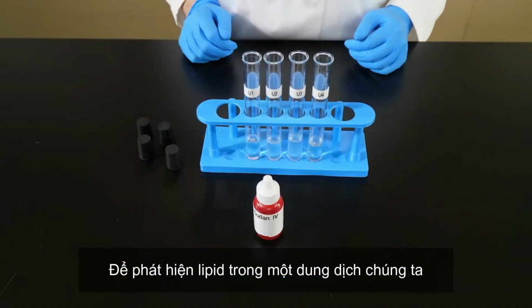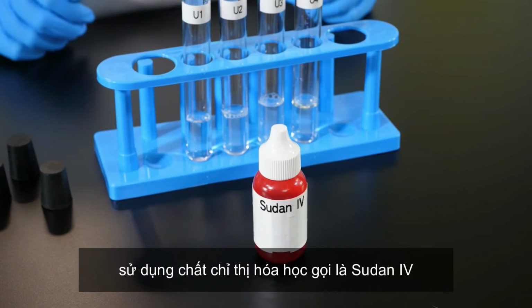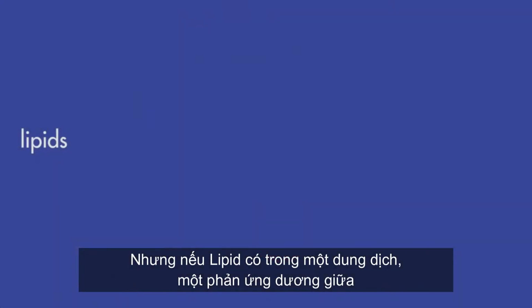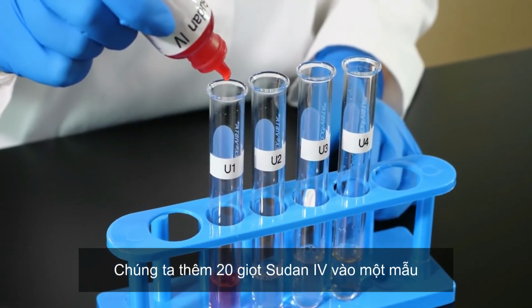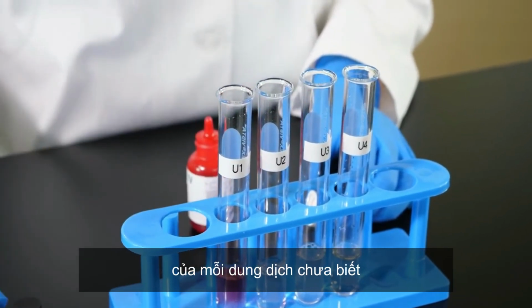To detect lipids in a solution, we use a chemical indicator called Sudan-4. Sudan-4 is a red dye that turns any solution red, but if lipids are present in the solution, a positive reaction between Sudan-4 and lipids will occur, and the lipids will turn dark red. We add 20 drops of Sudan-4 to a sample of each of the unknown solutions.